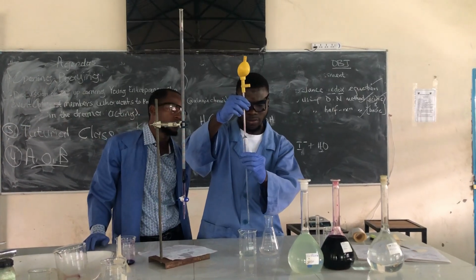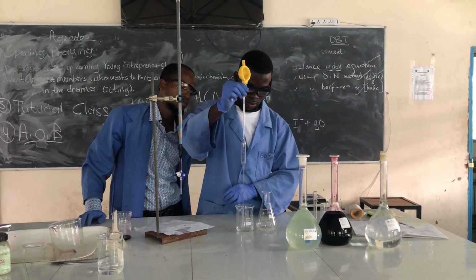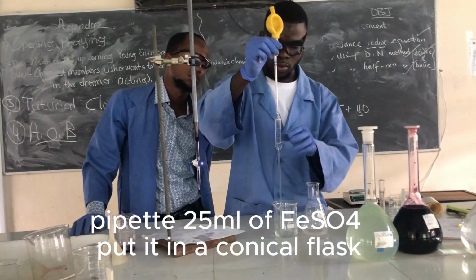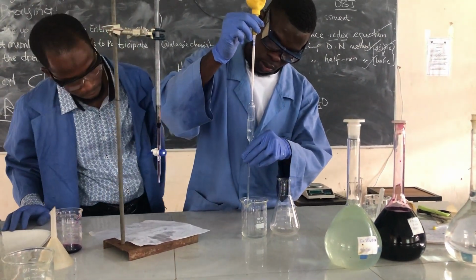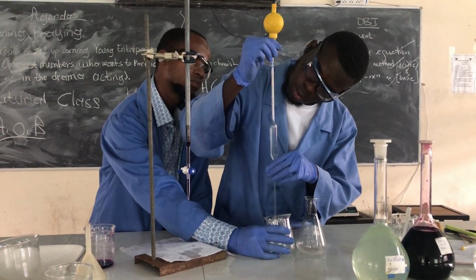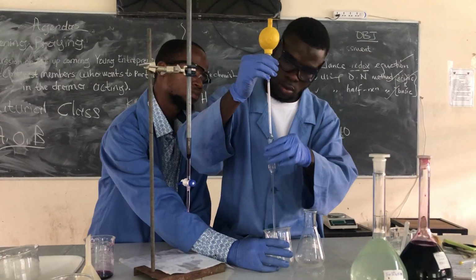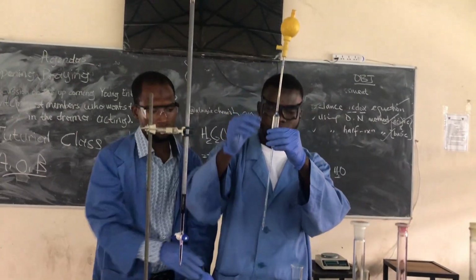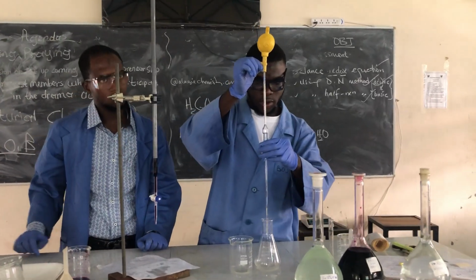The volume that we are using is 25 milliliters. Okay, so the line, then we put it in the conical flask.